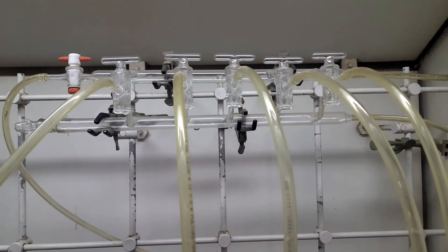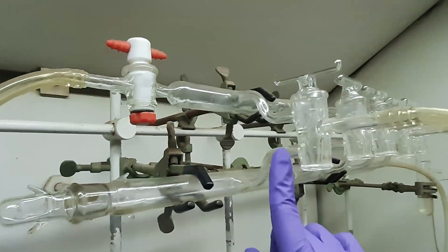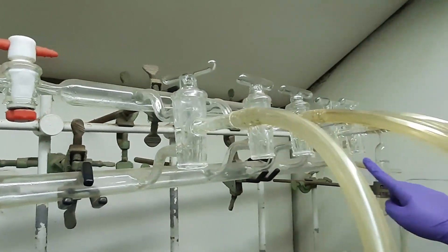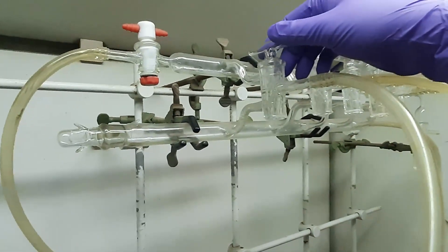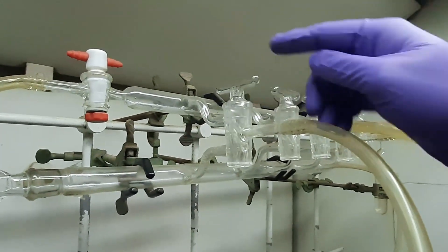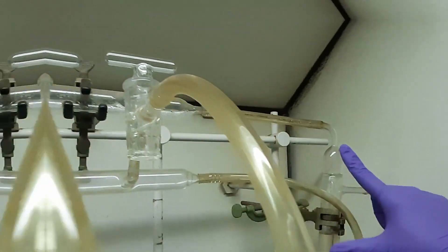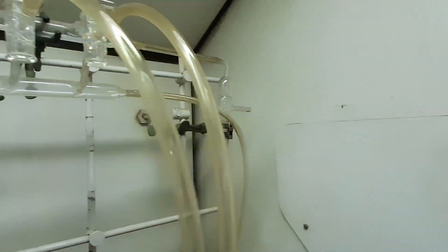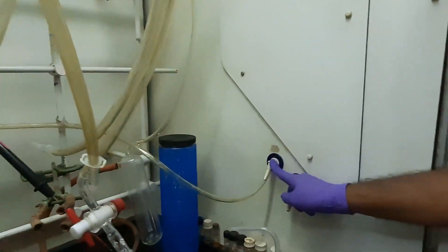Here we are connecting the pipe which goes to the reaction medium with the lower line. This is in turn connected to the cold trap, which is connected to the pump to absorb the moisture present in the reaction system. When we switch this to the upper manifold or upper line, it is on one side connected to the oil indicator — this is the oil indicator to check the inert atmosphere pressure. On the other side, this manifold is connected to the inert gas source, which is argon in our case.